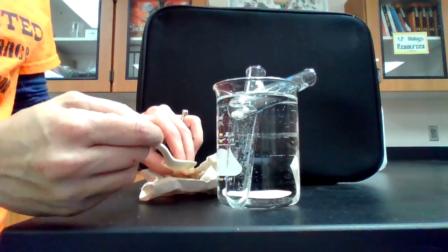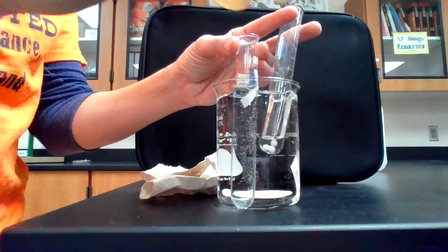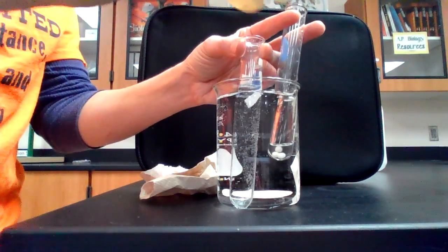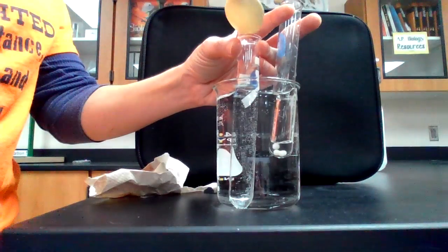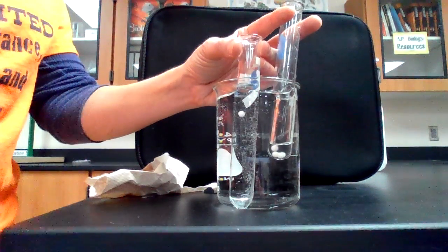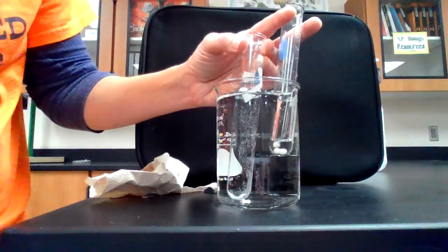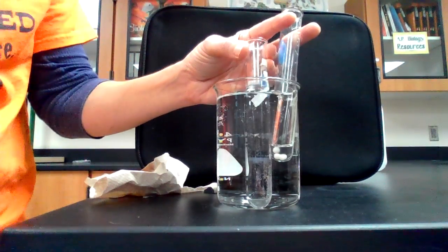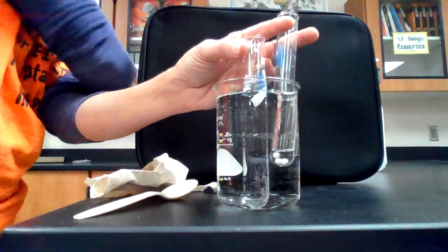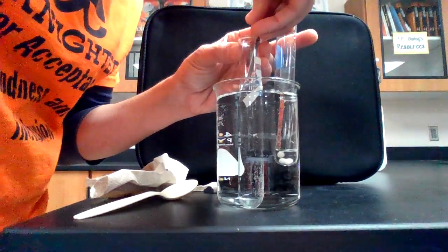All right, trial number 1 at room temperature. Let me hold this up for you. I'll move that out of the way. All right, trial number 1. Ready, set, go. Interesting. That did not even hit the bottom. Let me take that out, and we will see if that is repeated in the next one.